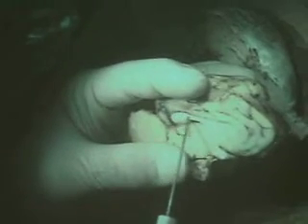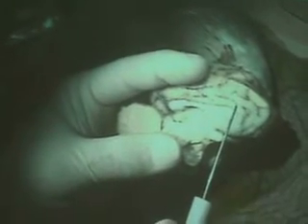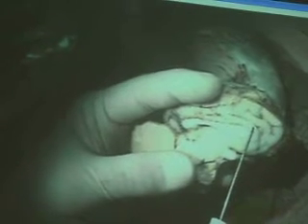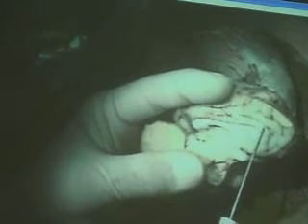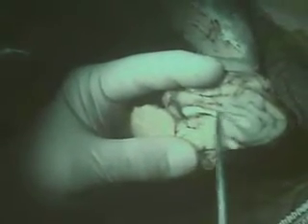The top portion is called the corpus callosum, and the corpus callosum is a tract. And what is the definition of a tract? It's a bundle of axons in the central nervous system. And this happens to be a tract that connects the right and left portions of the brain. So that's what this is. This is the corpus callosum at the top.